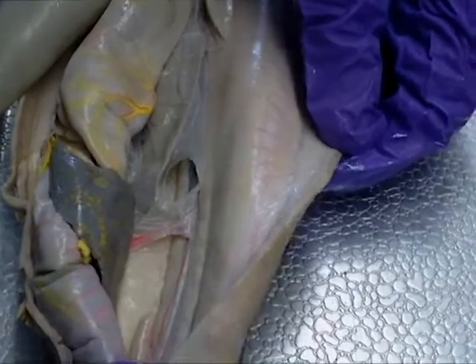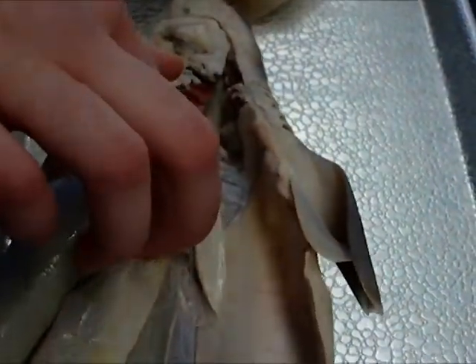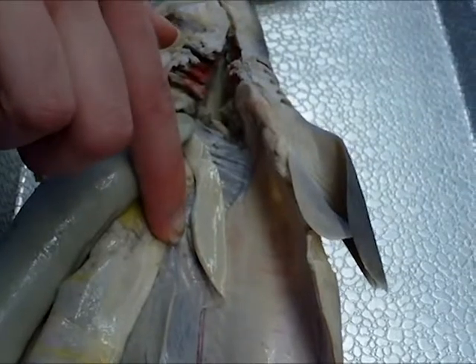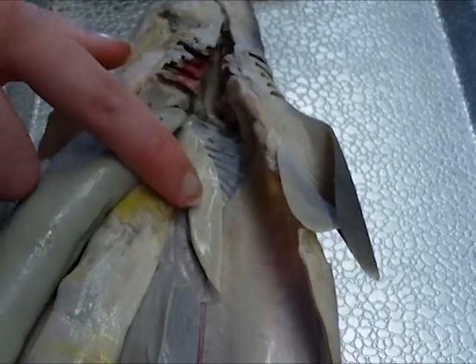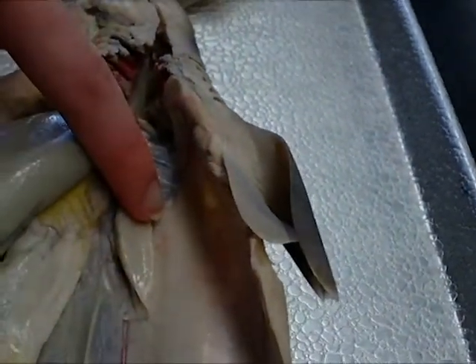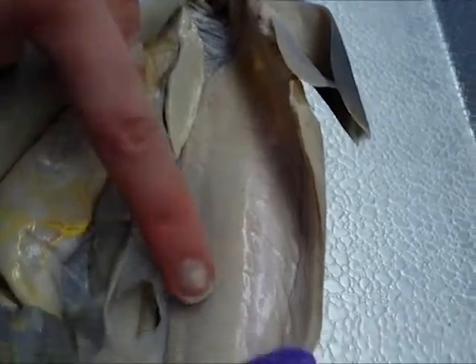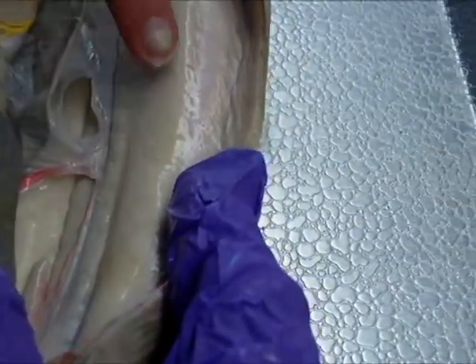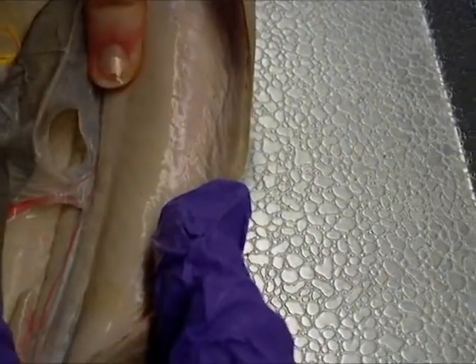We'll trace the path of the egg — hypothetically. From the ovary, it's going to go up and behind here to the nidimental gland, and then travel down the oviduct to the uterus, which would be seen in this area if it was mature. That's pretty much it.